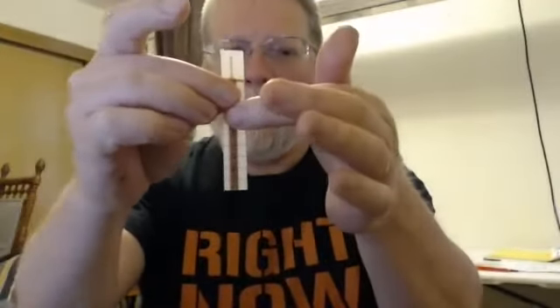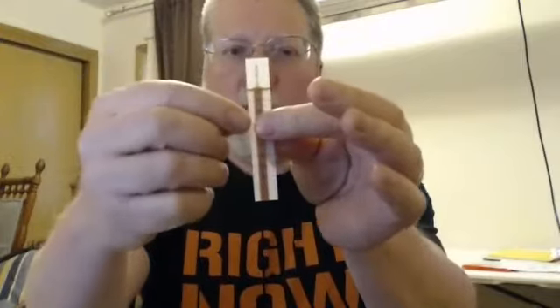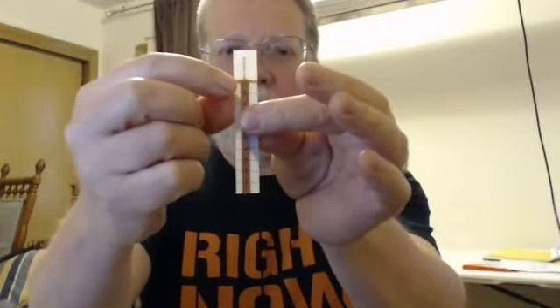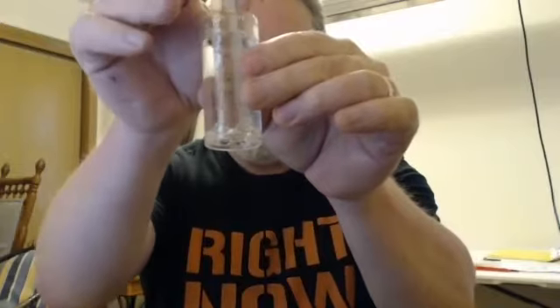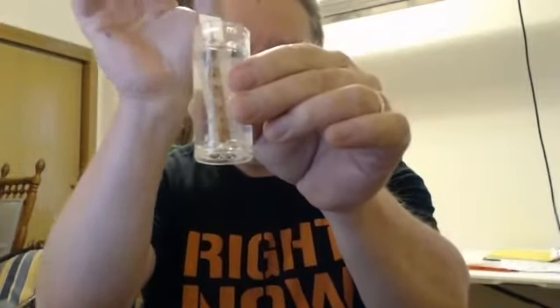This fabric here will draw water up. When the water hits this orange area, that will turn black, which means the test has been developed and is complete. We'll get that started right away, just putting the tab right in there like that. It will take 5 to 10 minutes, so we'll set this aside for now.